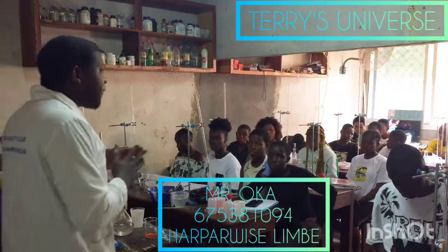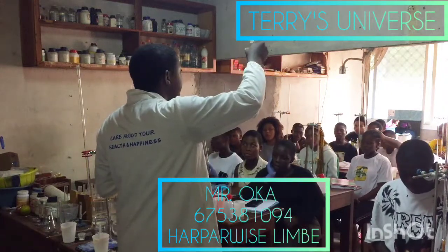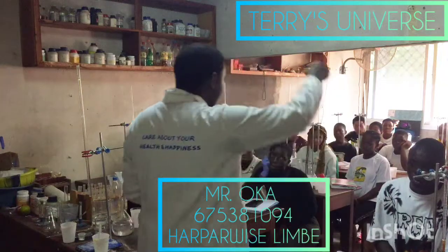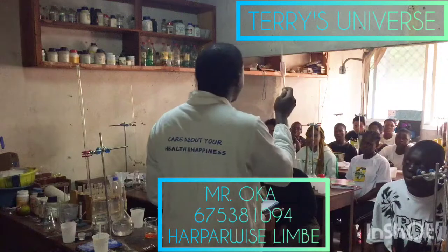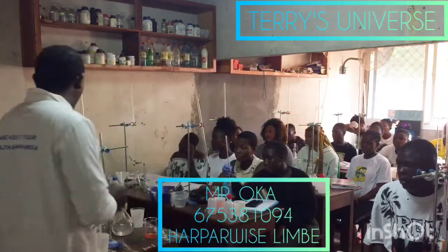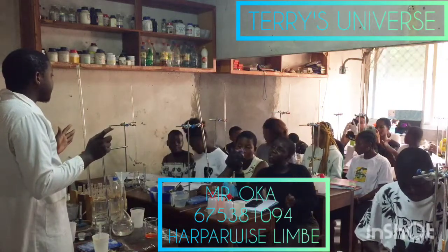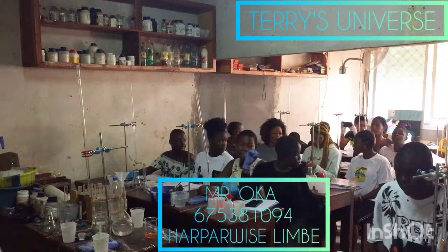Before we start, let's look at the instruments. Which instrument is this? A 250 cm³ volumetric flask. What's this? A wash bottle. What's this? A conical flask. So I'll carefully carry out my demonstration first, and then after that you carry out yours as a group — two per step.